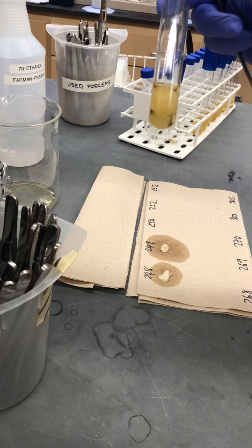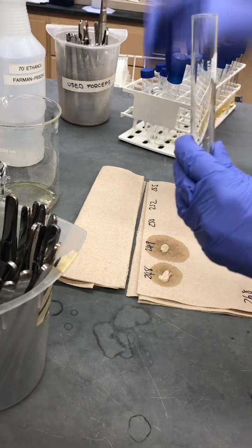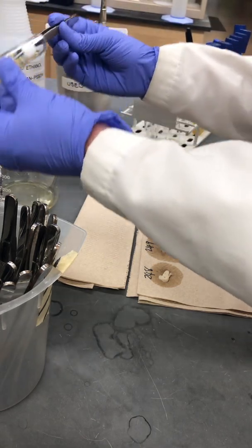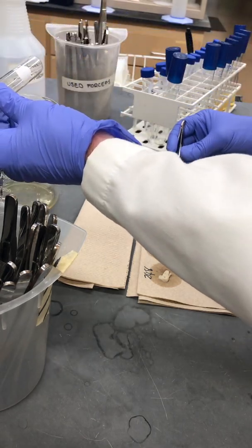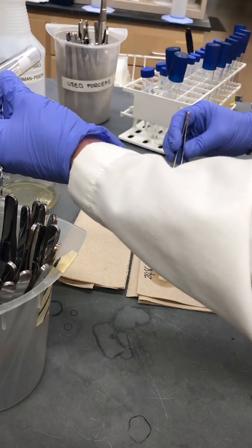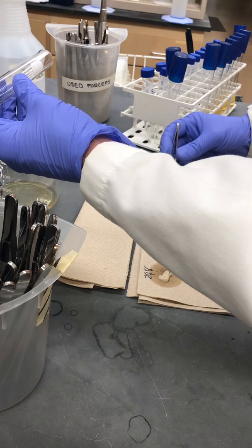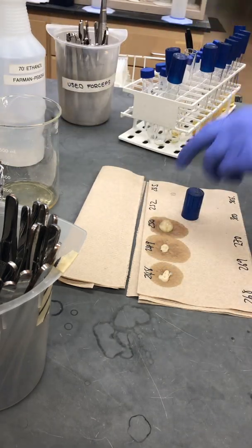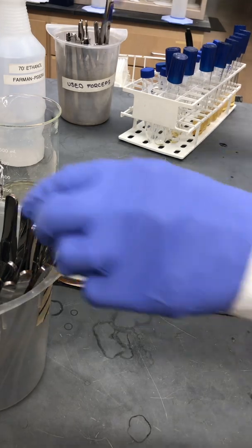This is a single spore culture, and then we'll just reach in with a pair of sterilized forceps and grab the mycelial ball and any hangers-on in there, and put them onto paper towel to blot them. Then we will move on to the next sample after we've completed this.